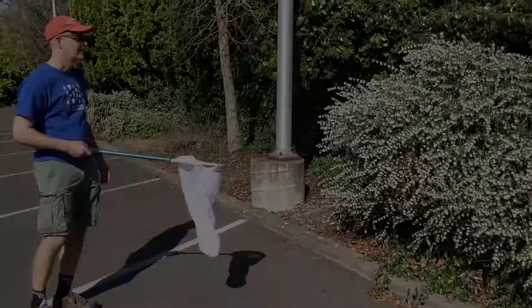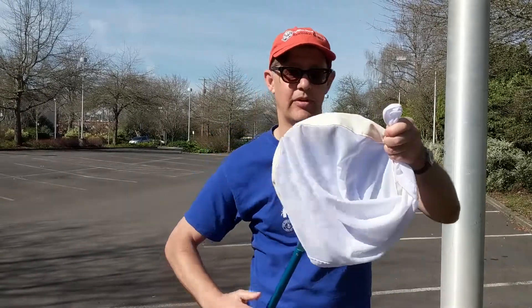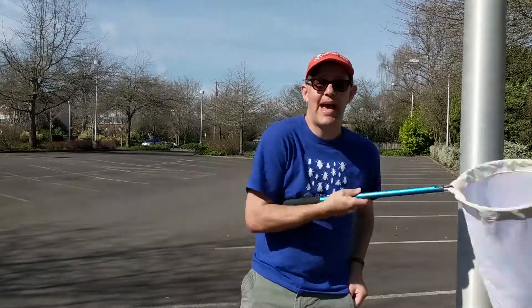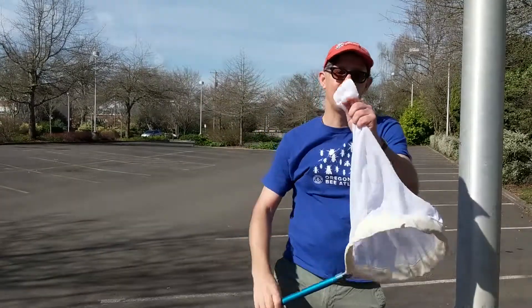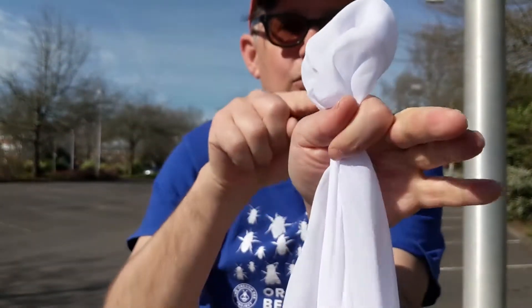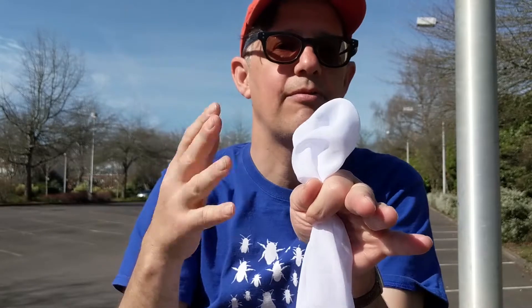Notice the only place I'm holding on to the net is right here — I'm not holding on to anything else, so my other hand is free. When I caught the bee, I took the net bag and swung very vigorously to force the bee back to the very back of the net bag. At that point I turn the net over like this, and if I do this quickly enough the bee will be right in the top of the net bag. I've crimped it very close to the end so there's no room to chase the bee down with the jar — everything is tight and close, which makes this job very easy.